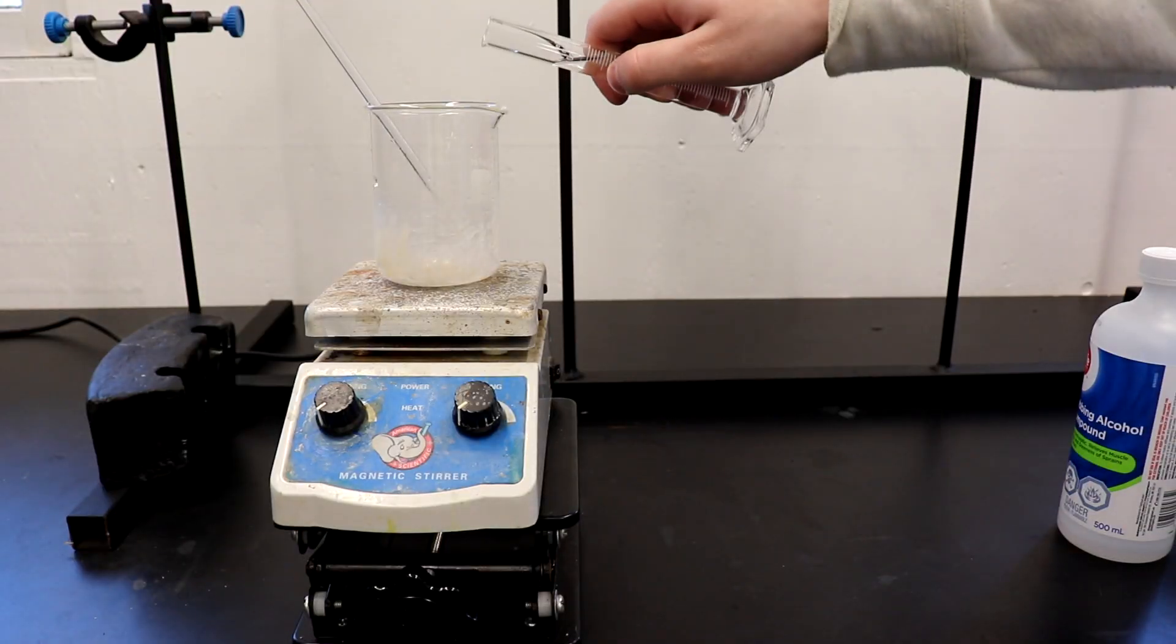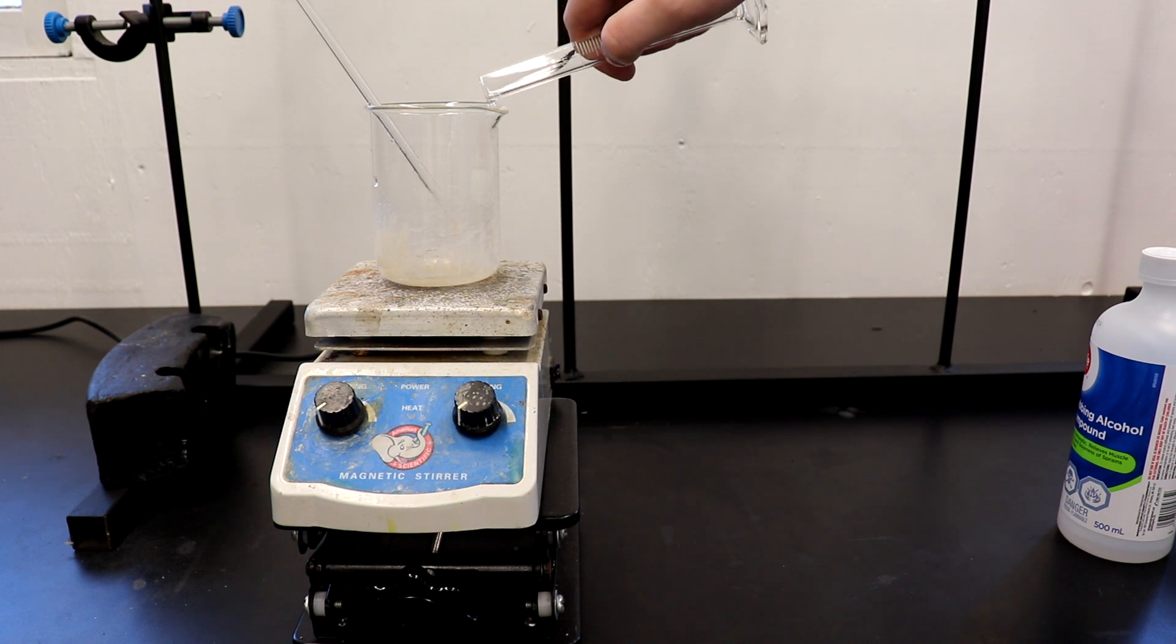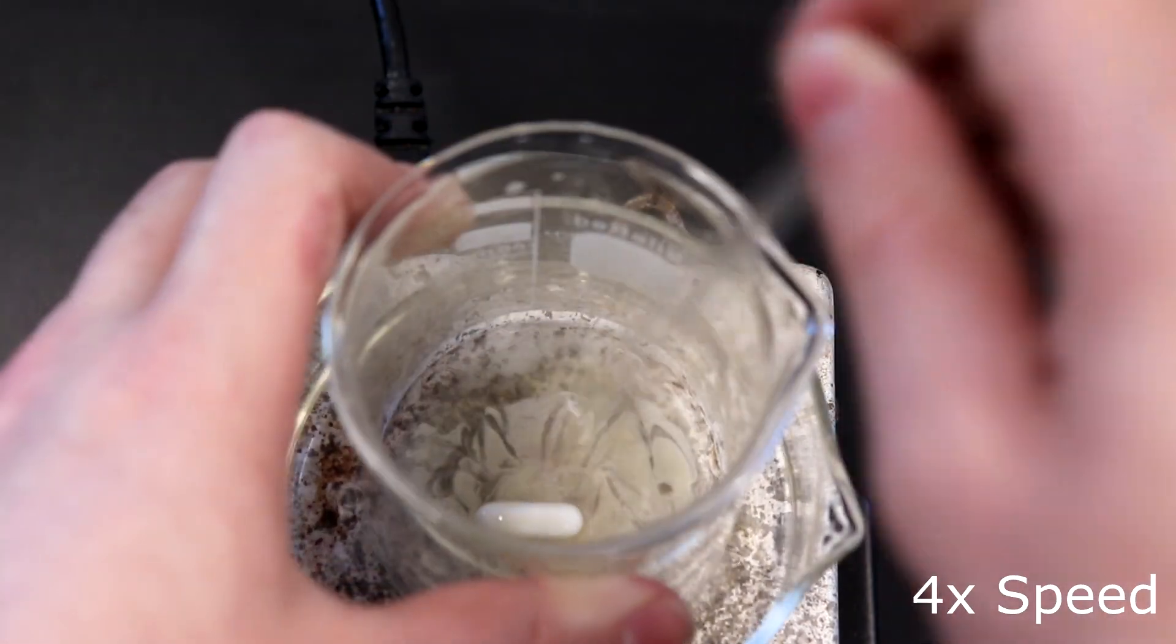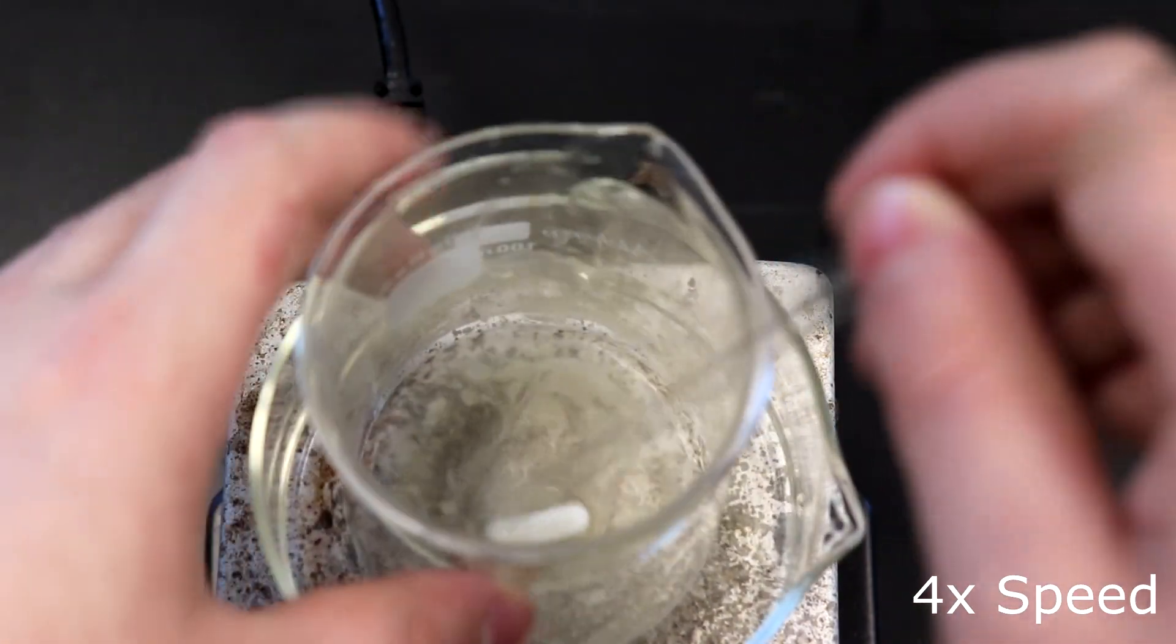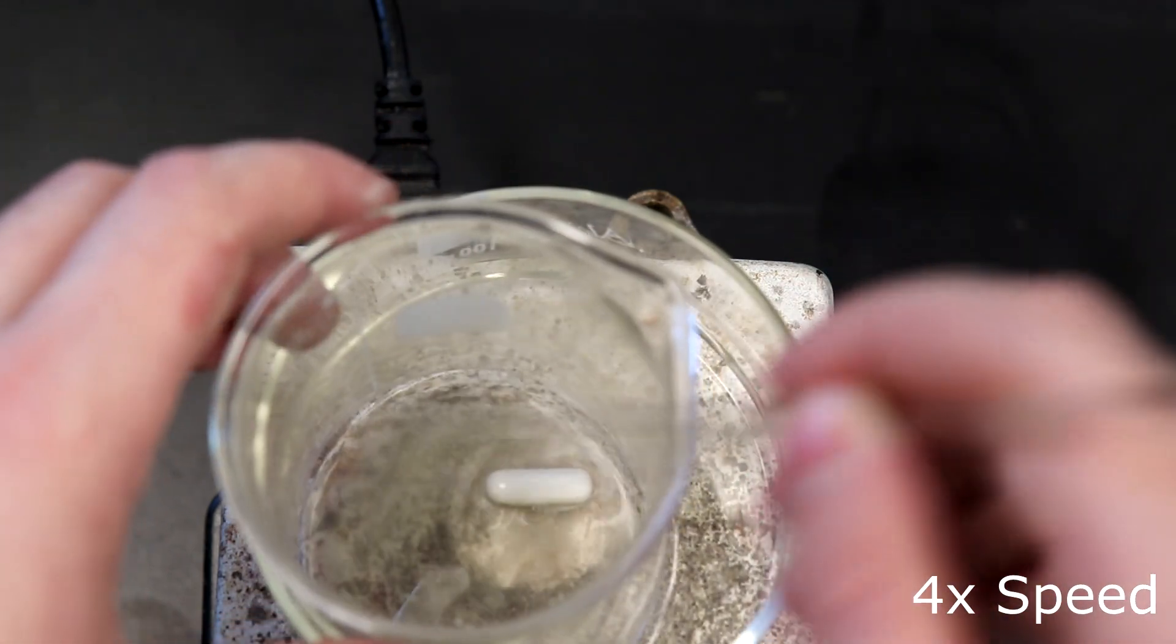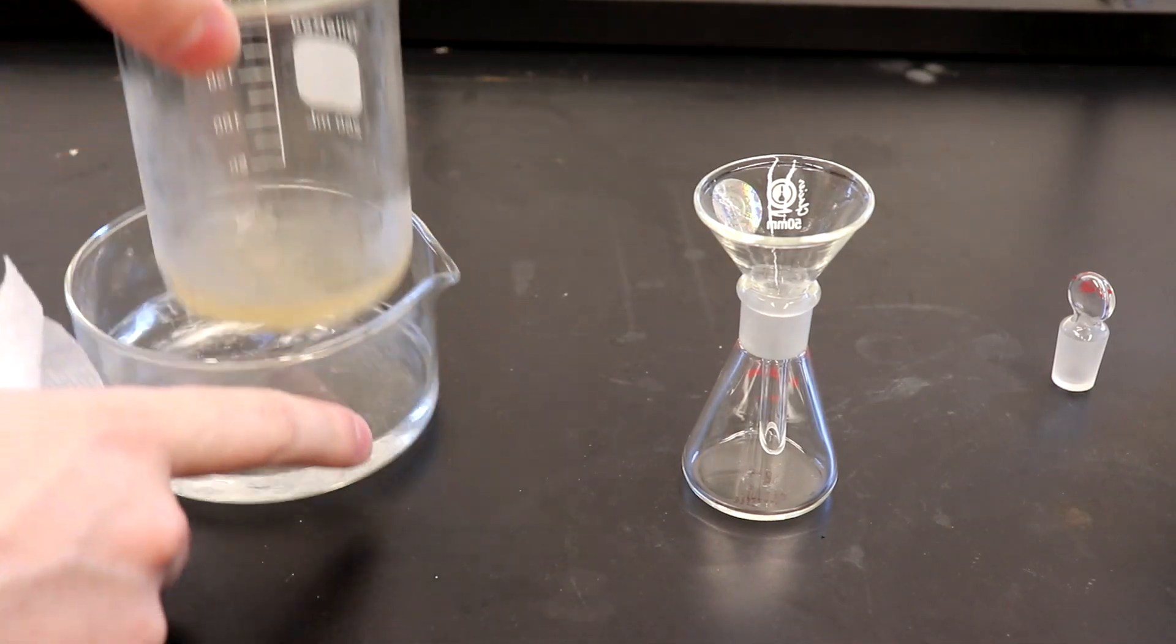The product was dissolved in 10 milliliters of ethanol on a hot water bath. This product was extremely difficult to crystallize out and it much preferred to be a syrup rather than nice crystals. It took multiple attempts over multiple days to finally get this product to crystallize.